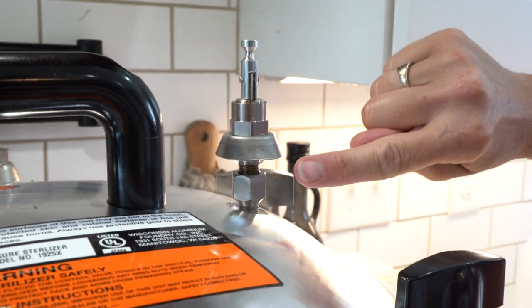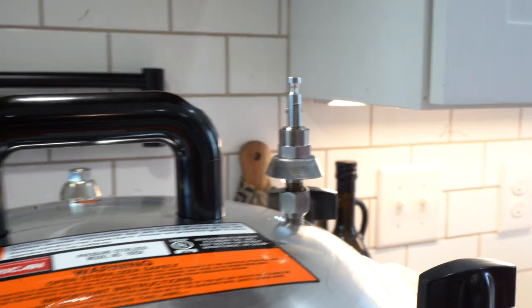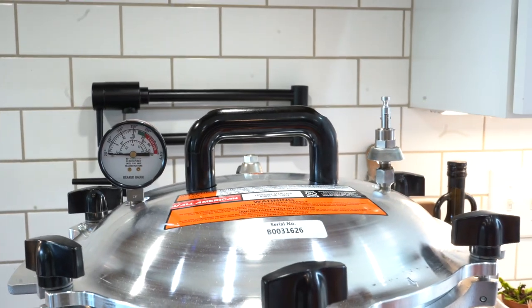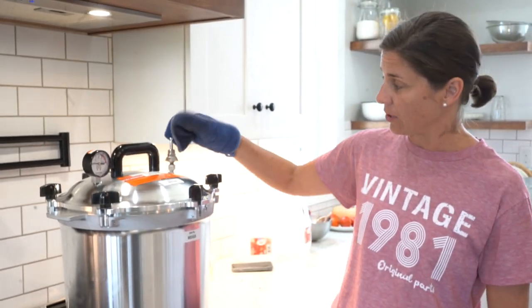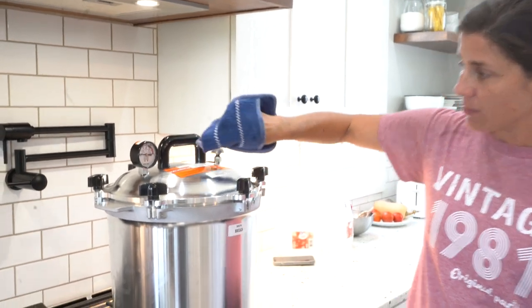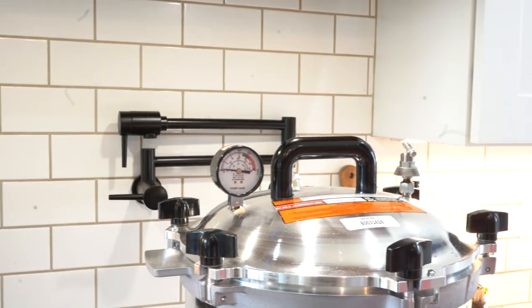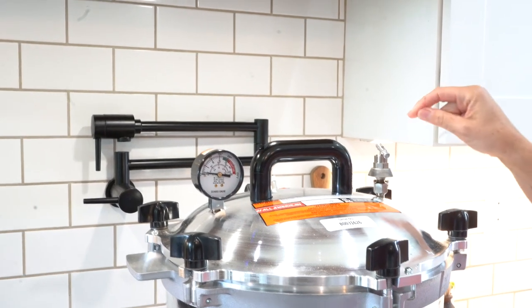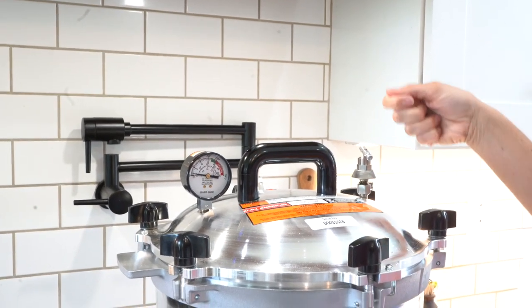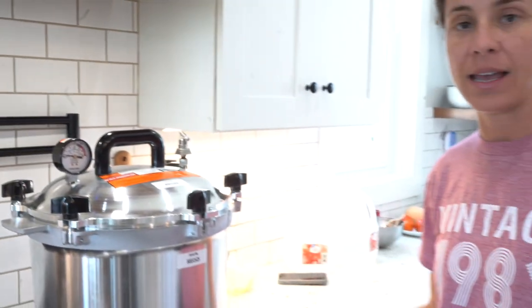I've got some steam coming out here so I'm going to track this for five minutes. It's been five minutes and the steam is still building, so I'm going to close this valve. Then I'm going to wait and watch the pressure build up to the green zone, and then we will release for another three to five minutes. Once we open it to release and then close again, the actual steam — not trapped air — is what's in the sterilizer.